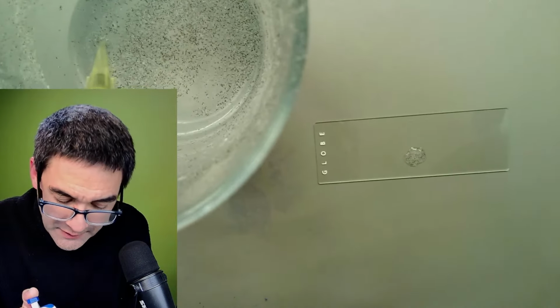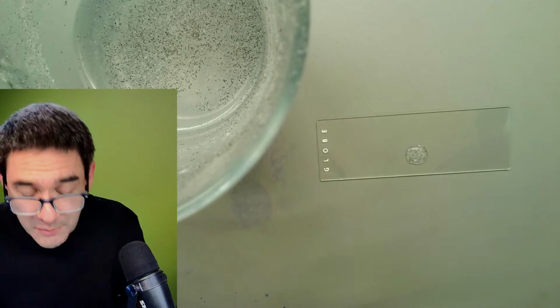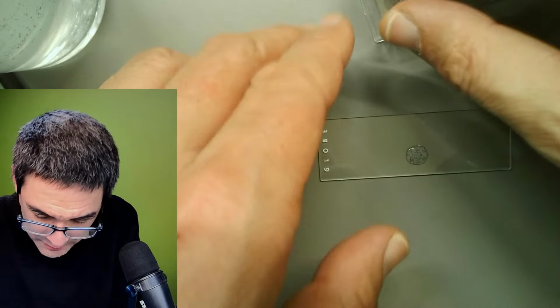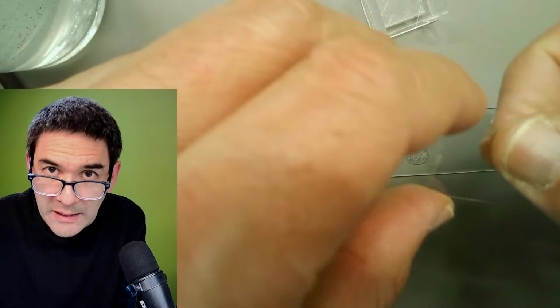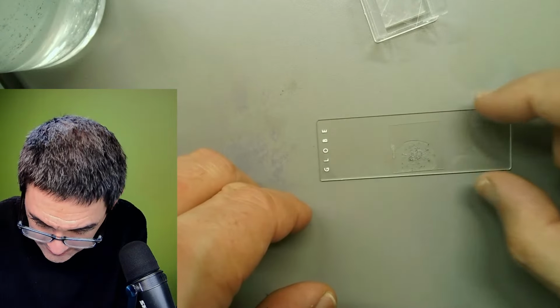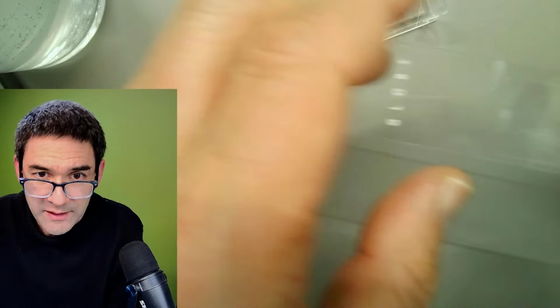Purifying it to get a nice image would be the next challenge. But for our purposes, I think it's going to be fine. And as you probably already have noticed, my hair is not all black anymore, but I'm also now getting some white hair. And this actually is also quite interesting to look at. And I hope that we're able to find something interesting here.